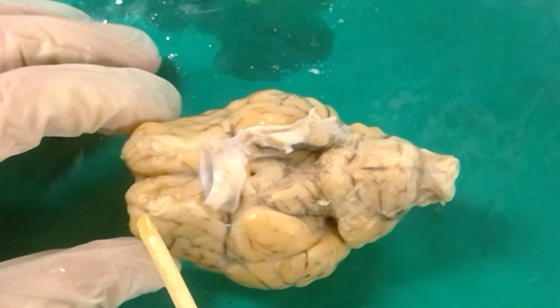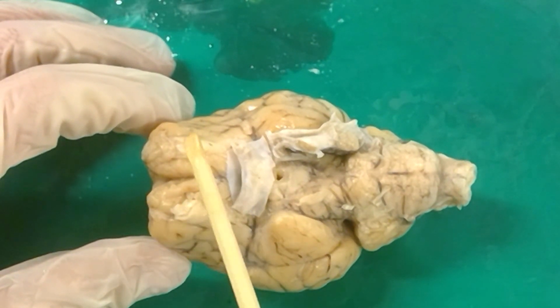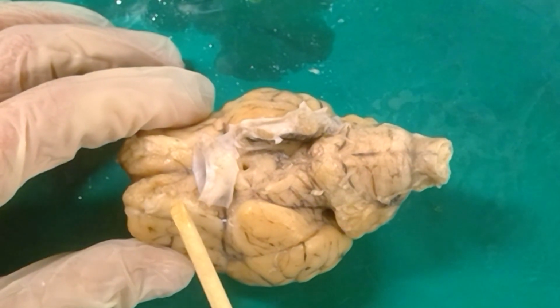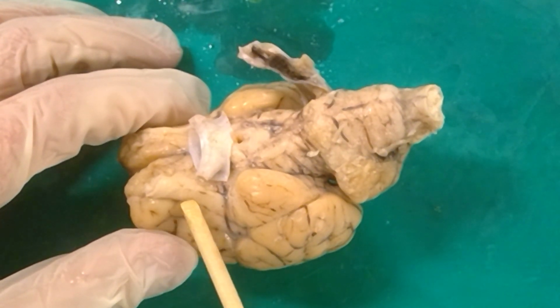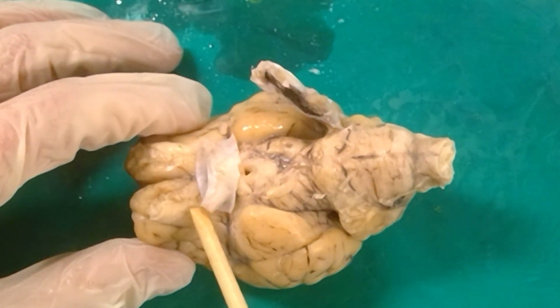So if we begin here with the front of the brain, the first cranial nerve is the olfactory nerve, where this is the remains of the olfactory bulbs, and their information will be entering into the brain through the olfactory nerve. And what we can see here along the side, going from about this black line to about right here, this is the lateral olfactory gyrus.